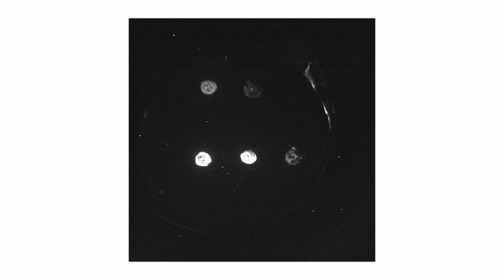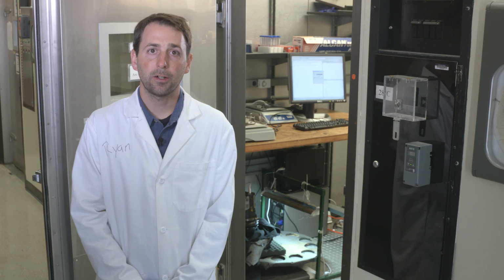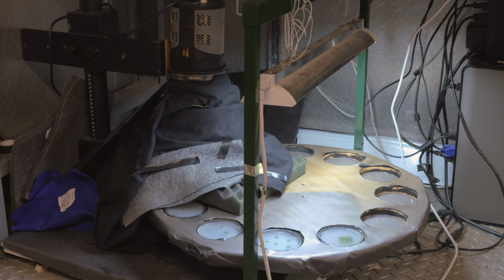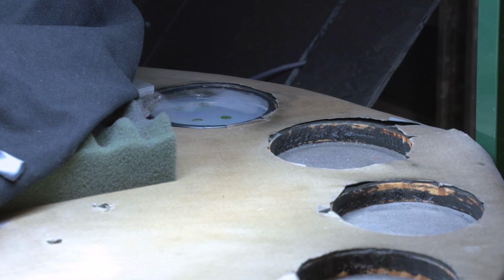The CCD camera will detect the amount of photons, light, produced over a 3-minute period of time. After imaging, the turntable will rotate to release the plate back into the light. Note that we determined experimentally that these short periods of darkness every 2 hours do not affect the clock. The cells can reset their clocks if presented with hours of darkness, and the rhythms can get messy if we give a short dark pulse too frequently. Both the data and the video are collected by the computer.